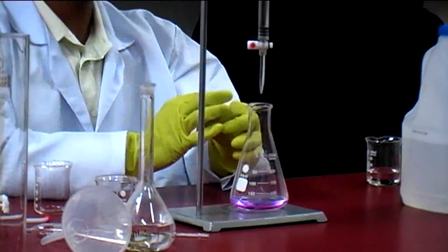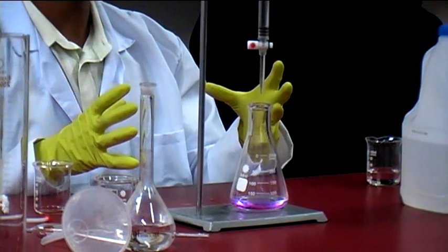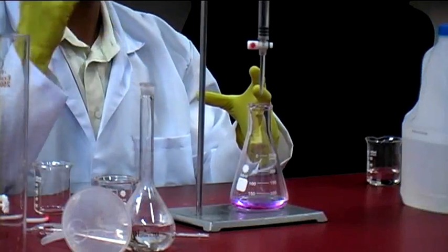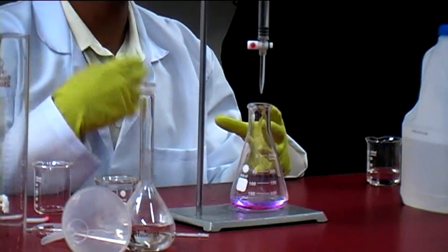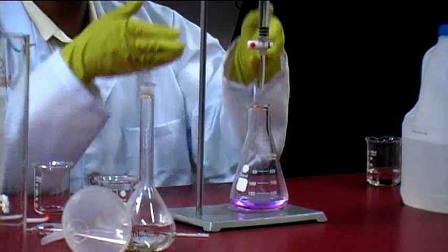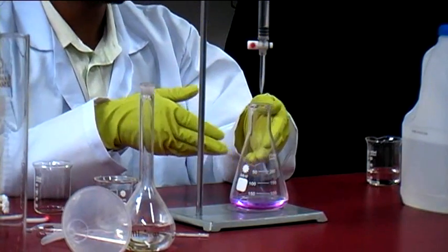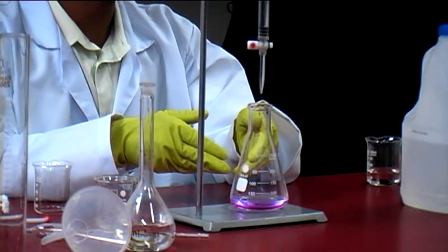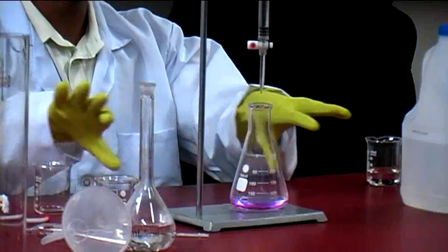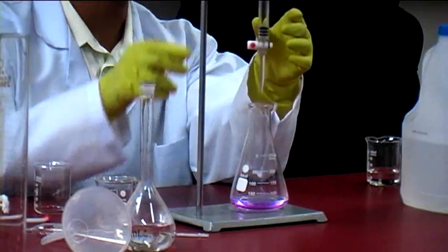Occasionally, sometimes it will become colorless around the area and pink all the way around, and when you swirl it around everything becomes pink. So it hasn't completely finished. And it makes sense because the acid that's neutralizing, it's only going to neutralize in the area where it falls. It needs time to then move around. So swirling it around helps to move around.